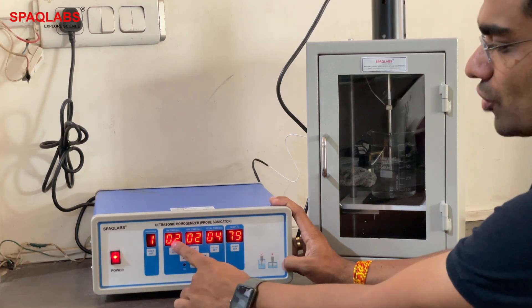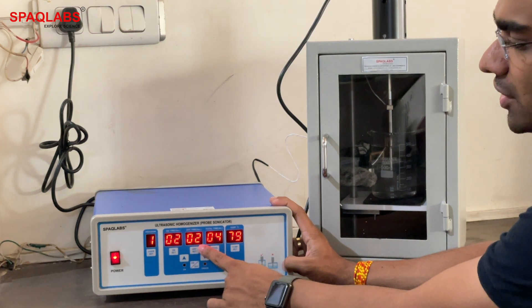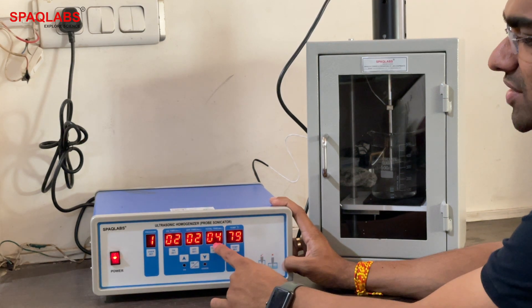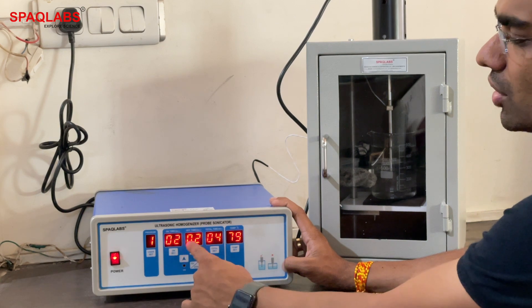On time is measured in seconds — this is set to two seconds on time. Off time is again two seconds. Total time is four minutes, meaning it will cycle two seconds on, two seconds off repeatedly for four minutes.